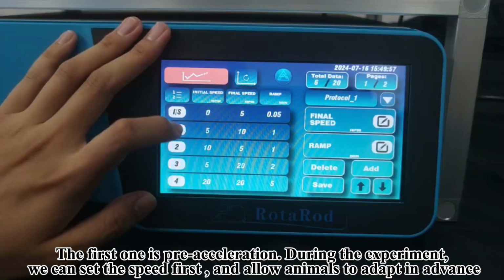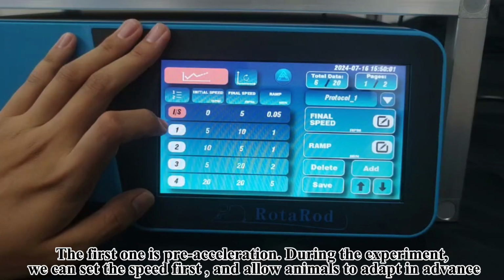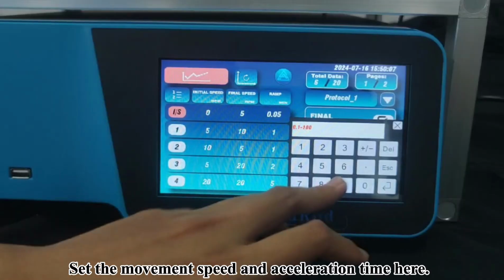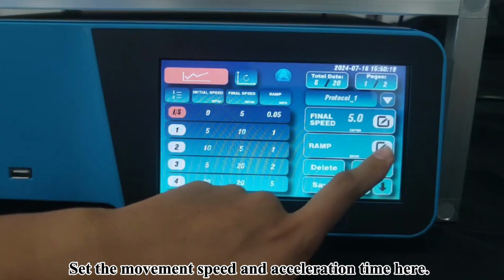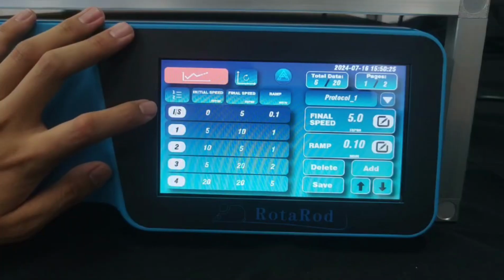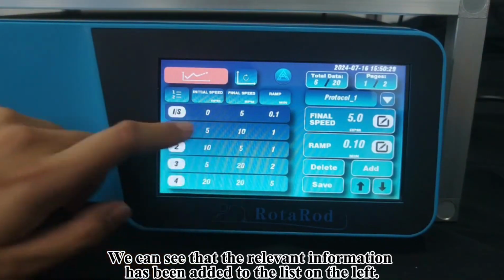The first one is pre-acceleration during the experiment. We can set the speed first and allow animals to adapt in advance. Set the movement speed and acceleration time here. We can see that the relevant information has been added to the list on the left.